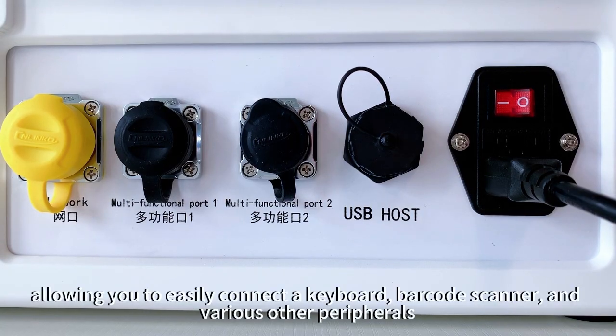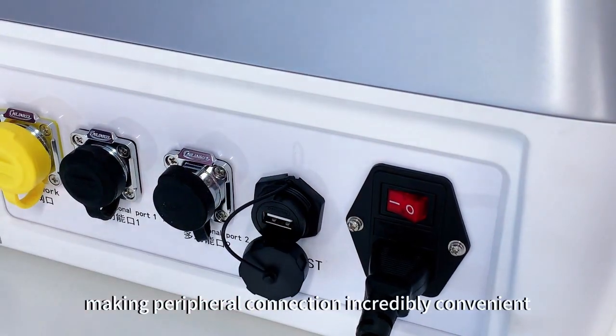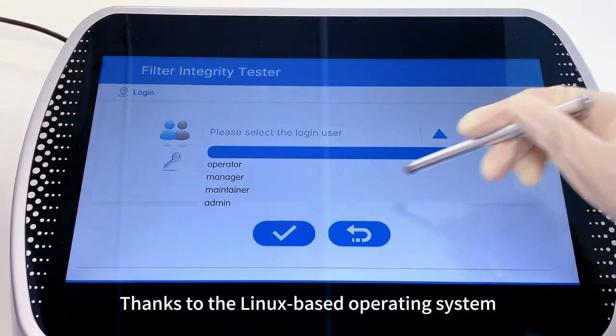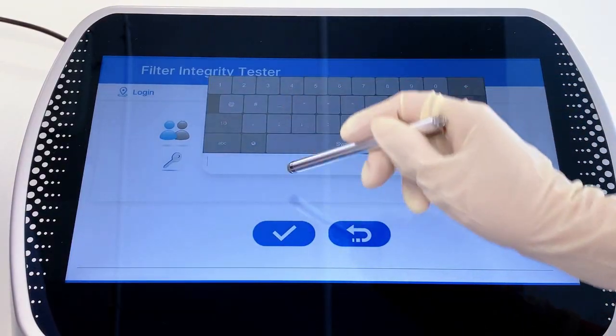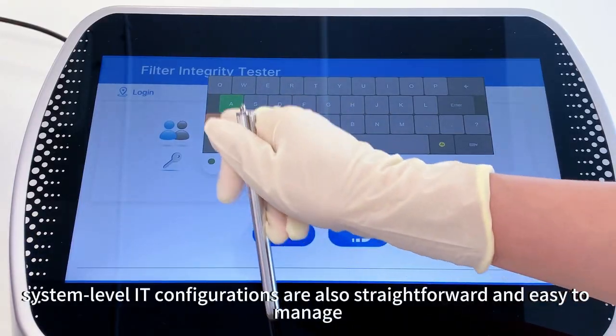At the rear of the device, you'll find multiple USB ports, allowing you to easily connect a keyboard, barcode scanner, and various other peripherals. An Ethernet port is also available, making peripheral connection incredibly convenient. Thanks to the Linux-based operating system, system-level IT configurations are also straightforward and easy to manage.